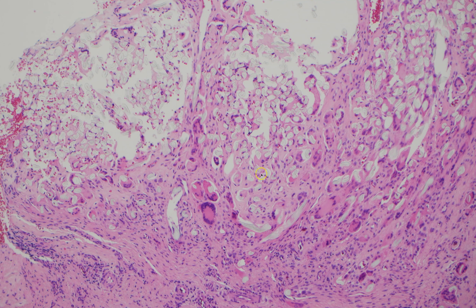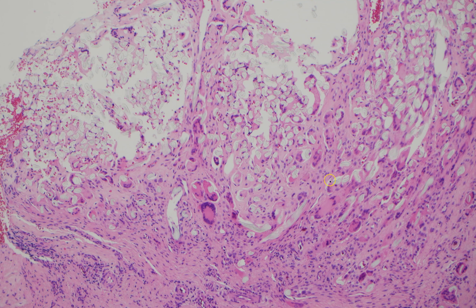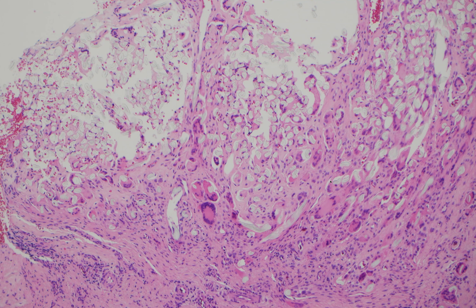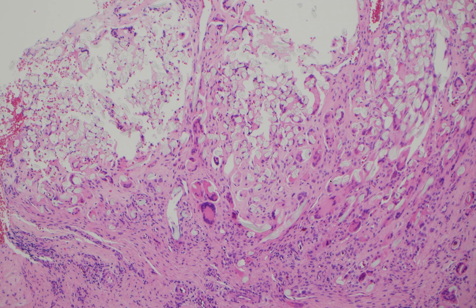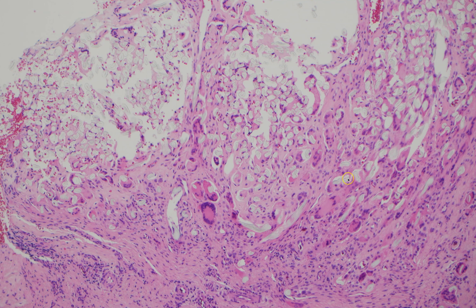So this is what I'm looking at on a glass slide — a picture I've taken with my microscope. One thing we have is a condenser on a lot of light microscopes. When you flip that, it helps make the light brighter at a higher magnification. We often keep that flipped on at higher magnification to make the slides look better. But when you're taking photos, or even just looking at slides, sometimes flipping the condenser off can be helpful.